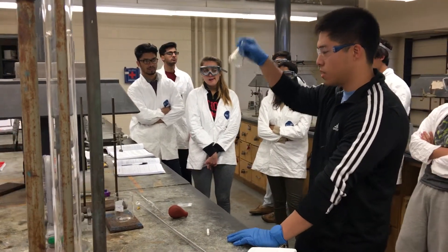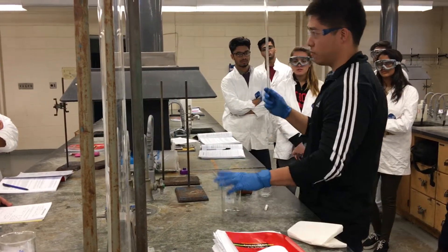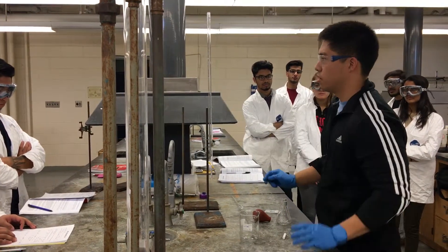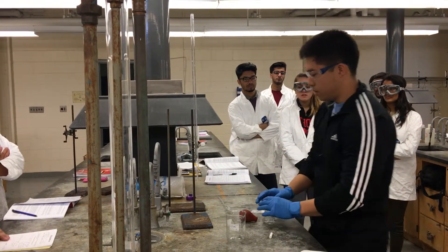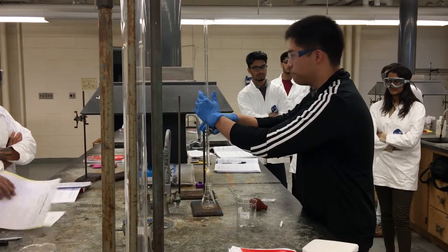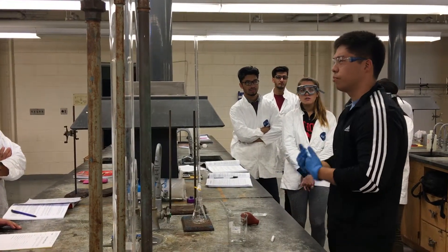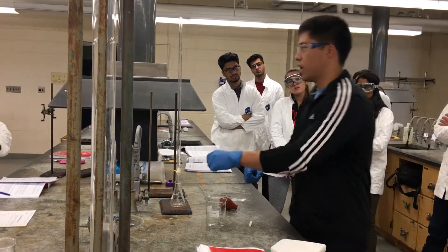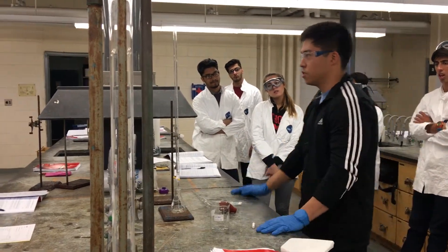Then come back to your burette and this is literally the same as what we did last week. Fill it up with your NaOH up to the zero mark — record that as your initial reading. Add streams of NaOH; you'll see color flashes of blue-green. Once the color starts to disappear more slowly while you're swirling, start adding drop by drop. When the color just stays, the titration is done. Record all data.